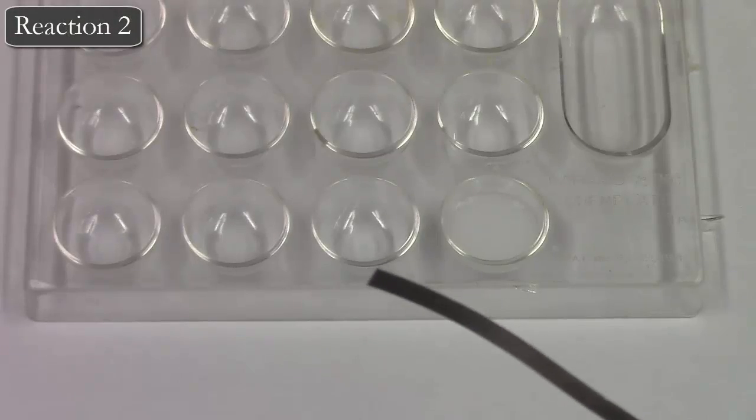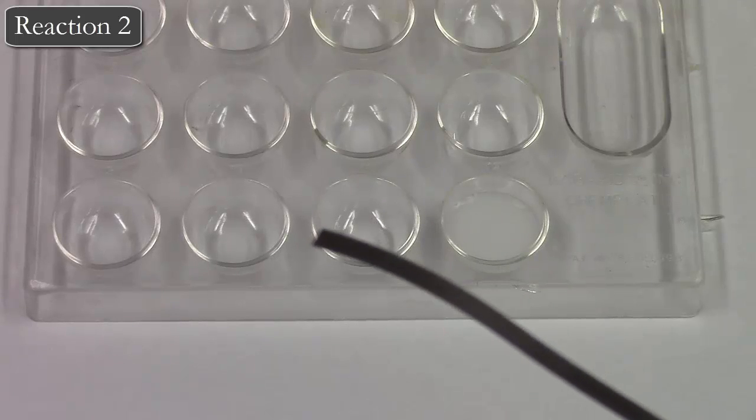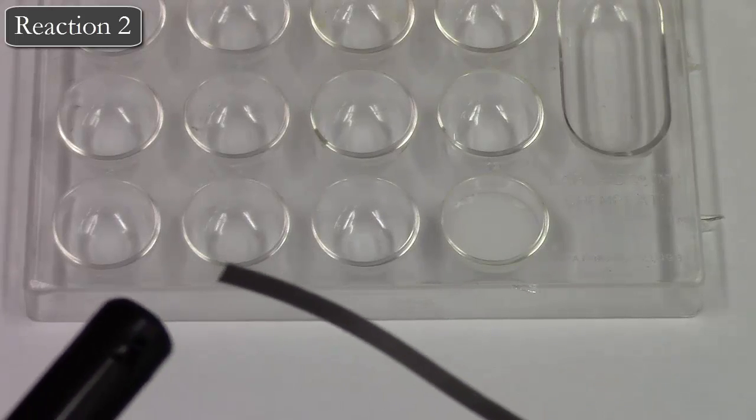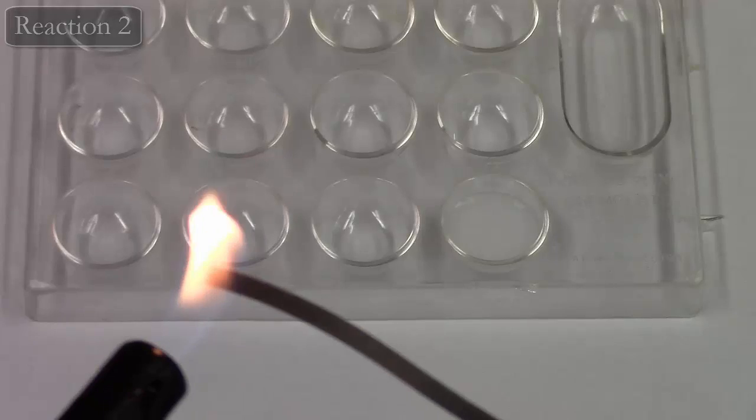For this next reaction, we're going to be burning a strip of magnesium, which you can see I'm holding here. This will be pretty bright.